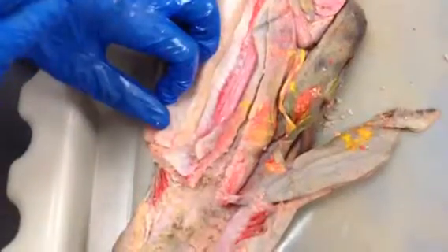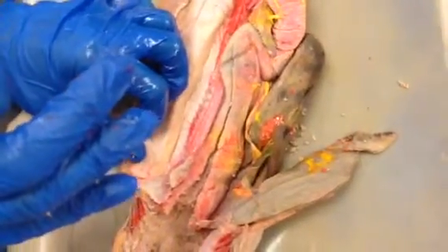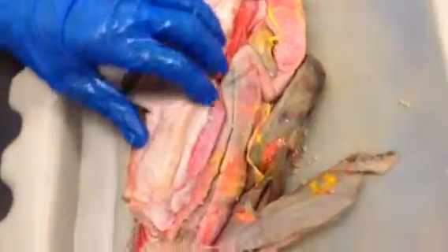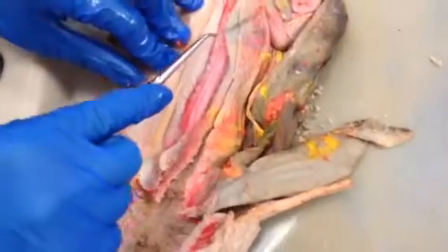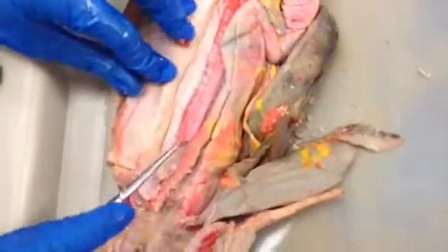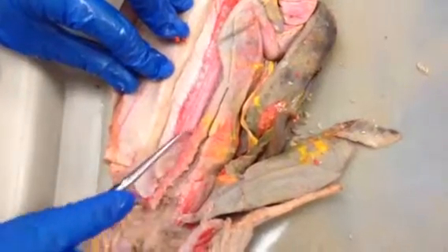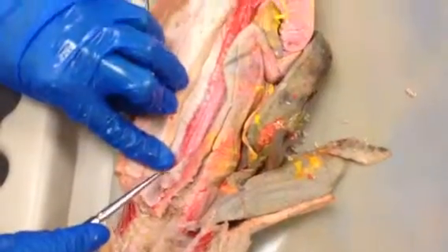Okay, I'm just going to skip describing all the stuff that we're not going to look at, because I feel like maybe that was more confusing, describing imaginary organs. This is the kidney that runs down here along the backbone. This is all kidney. The top third of it here is referred to as a Leydig's gland because it also contributes to production of seminal fluid.